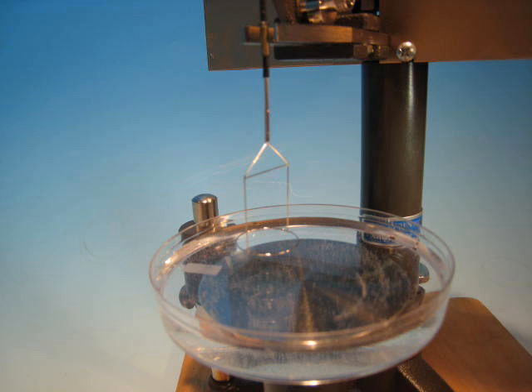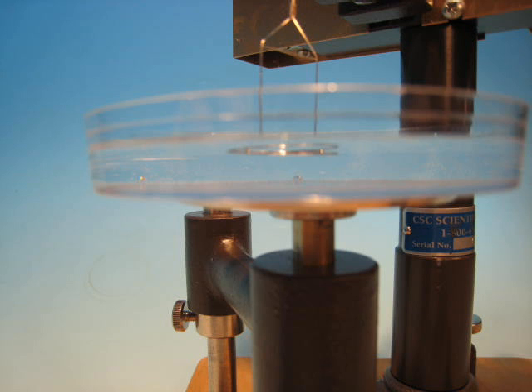Start the process with the ring above the surface of the sample. The pointer should be at the line on the mirror.